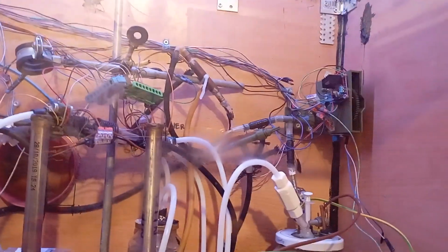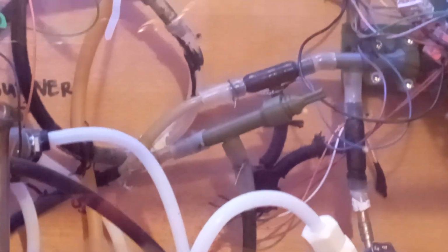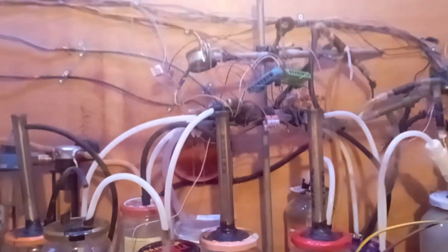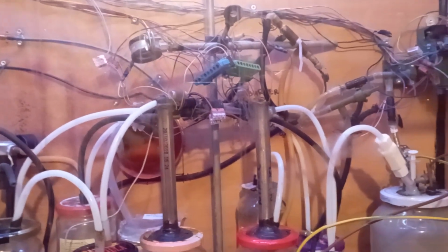So yeah, I have tested out the system. I have found some pieces. There's a needle valve that I have put on. We have to put on O-rings there and there, so the things don't leak. Tomorrow, yeah. I think this is it for today. It's not that much.